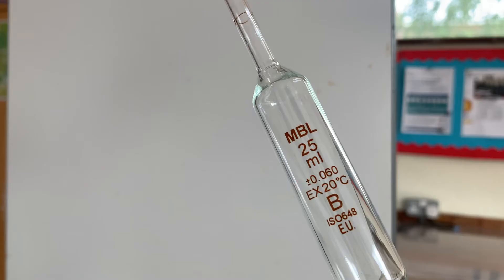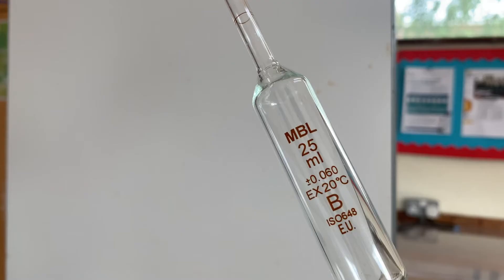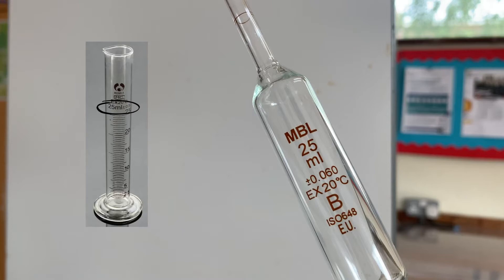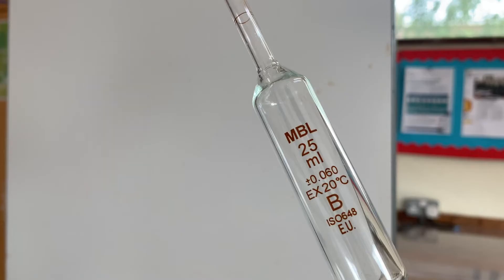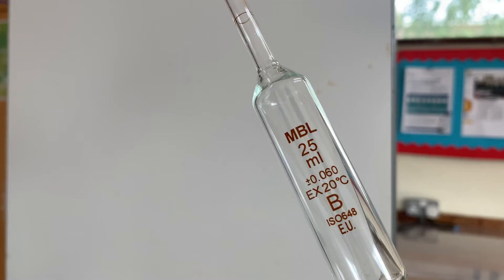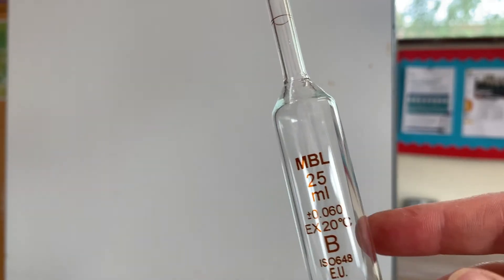This means that when the apparatus is used correctly you can end up with 0.06 millilitres more or less than the 25 mils it was designed to measure. By comparison, a 25 millilitre measuring cylinder has an inaccuracy range of plus or minus 0.5, so the volumetric pipette gives a more accurate measurement. Centimetres cubed and millilitres are used interchangeably here because they are equal units of volume.